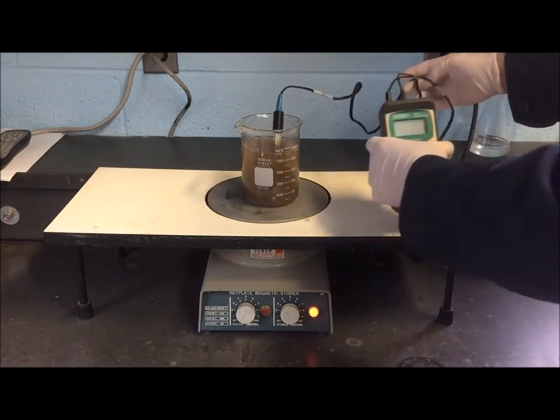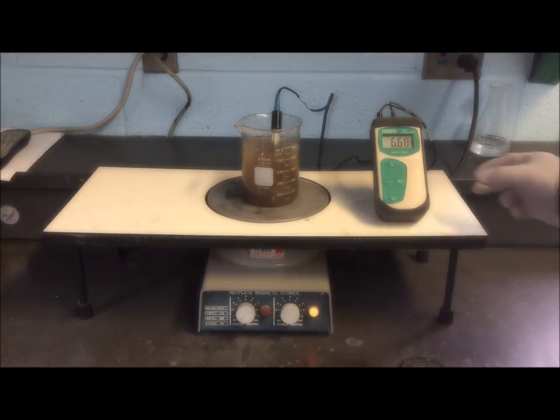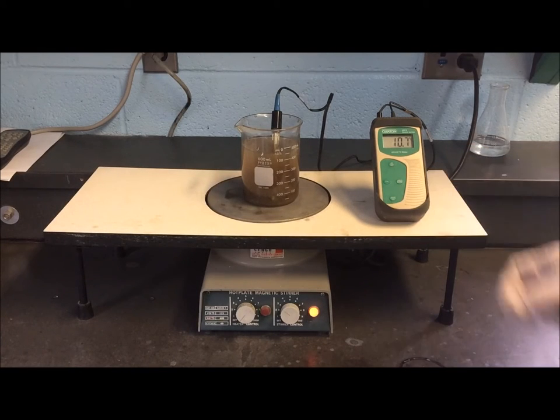The meter is placed in the sample and the pH is recorded. This meter also records the sample temperature in Celsius, which we will convert to Fahrenheit.